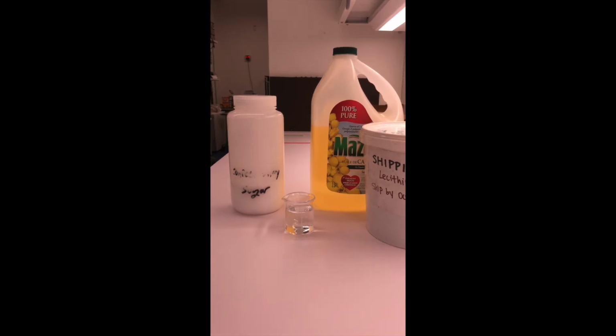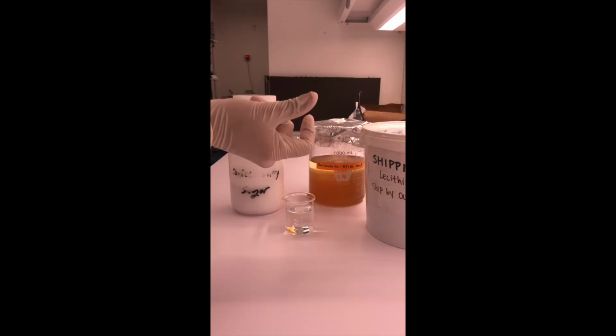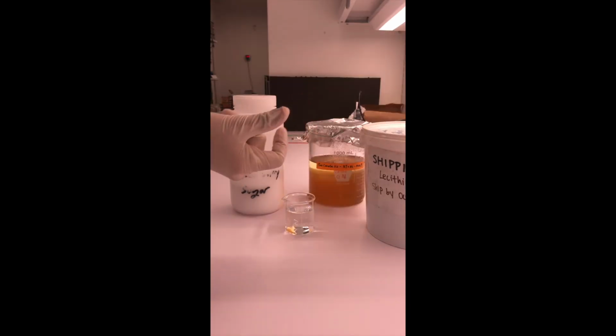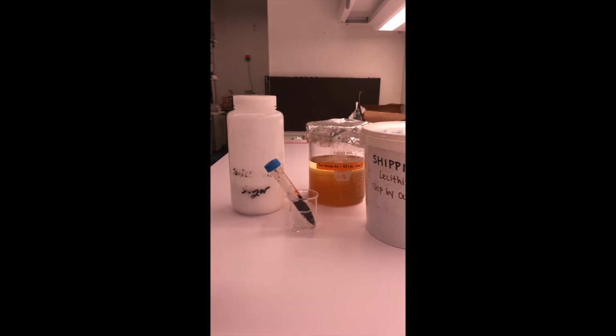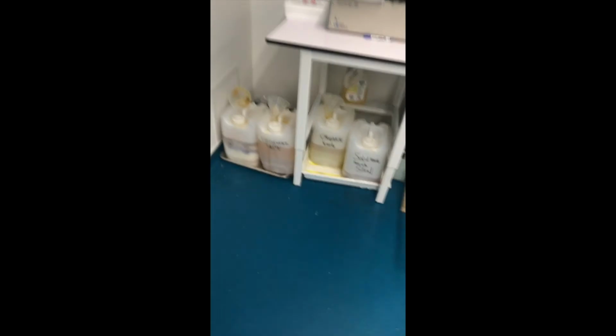Now, store-bought canola oil contains a lot of contaminants, and so I'm going to want to purify that, and boom, I have my purified canola oil, which I did in a separate process. And to be able to image my samples and essentially see where the water is going, I'm going to use a fluorescein solution, which is essentially just water and dye, which will allow me to see them in the microscope. And so now begins the process of mixing everything together.